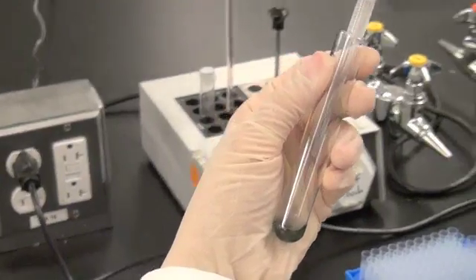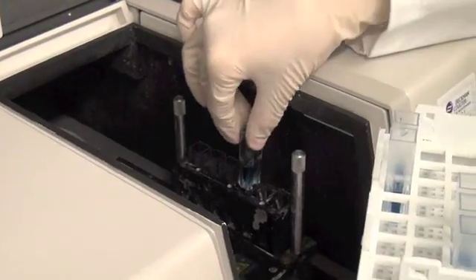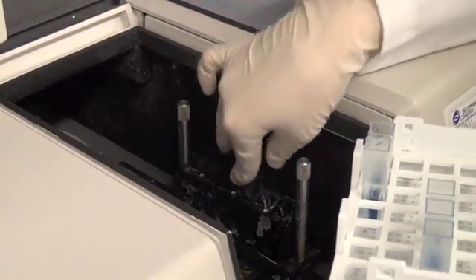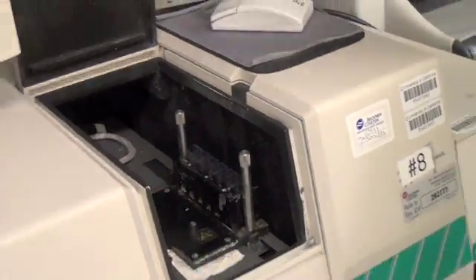Keeping the addition of the dye consistent with the order of measurement keeps the time of incubation in the dye qualitatively the same for all samples, which is important for consistency in measuring each sample in the same manner.